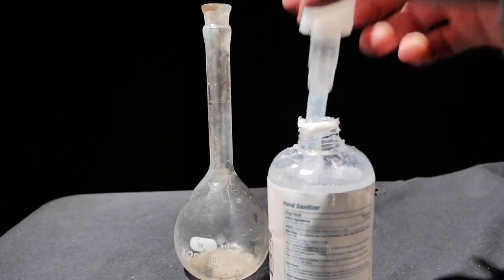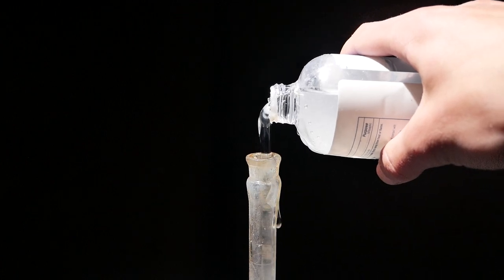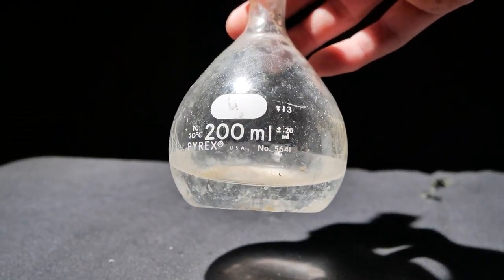Let's prepare the hand sanitizer. I've got it here and we're going to get rid of that. I'm just going to pour it into the top and I'm only going to put about this much because otherwise it'll boil over.